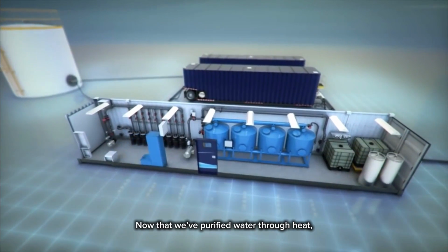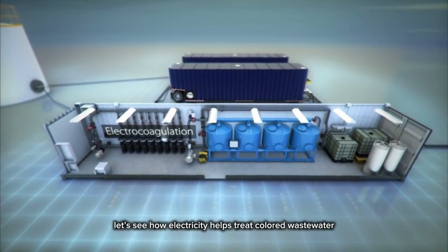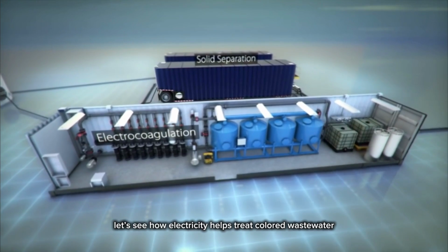Well, can you explain your answers further? Heating evaporates only water. Impurities with higher boiling points stay behind. So this method of purification is best for obtaining fresh water from seawater, right? Exactly. That's desalination. Now that we've purified water through heat, let's see how electricity helps treat colored wastewater.